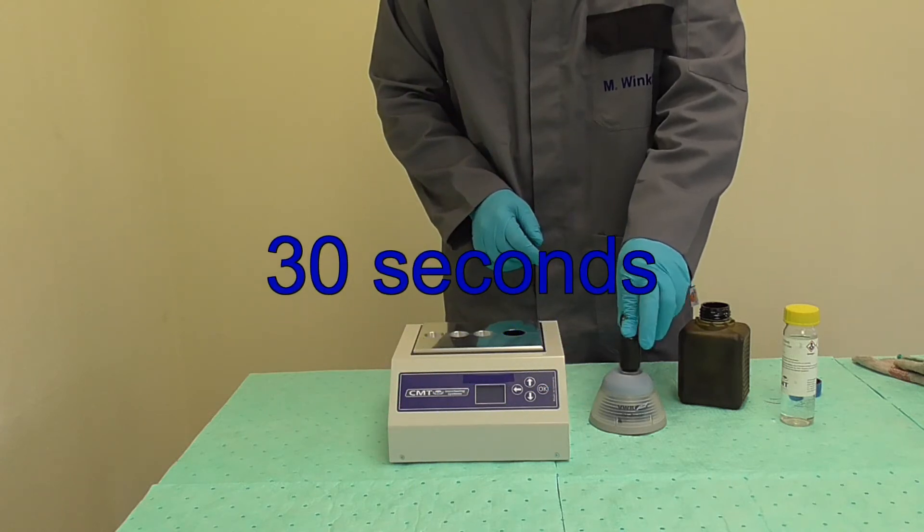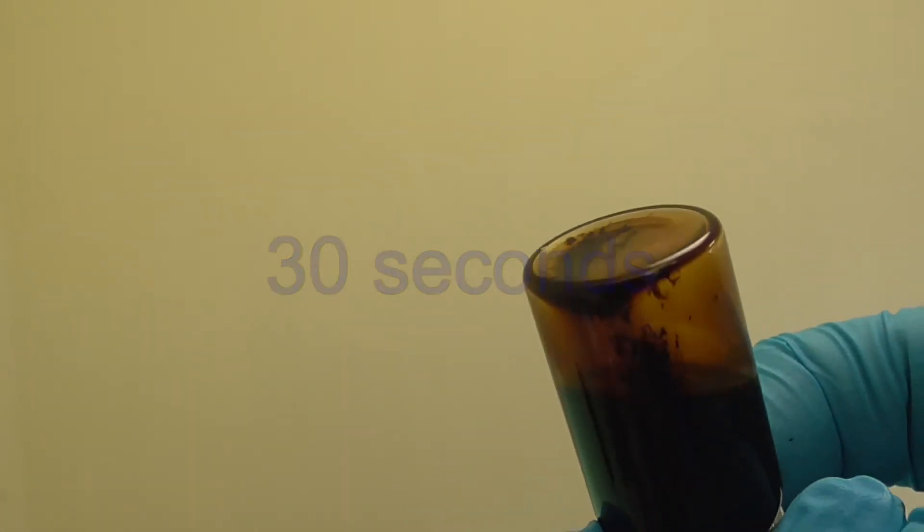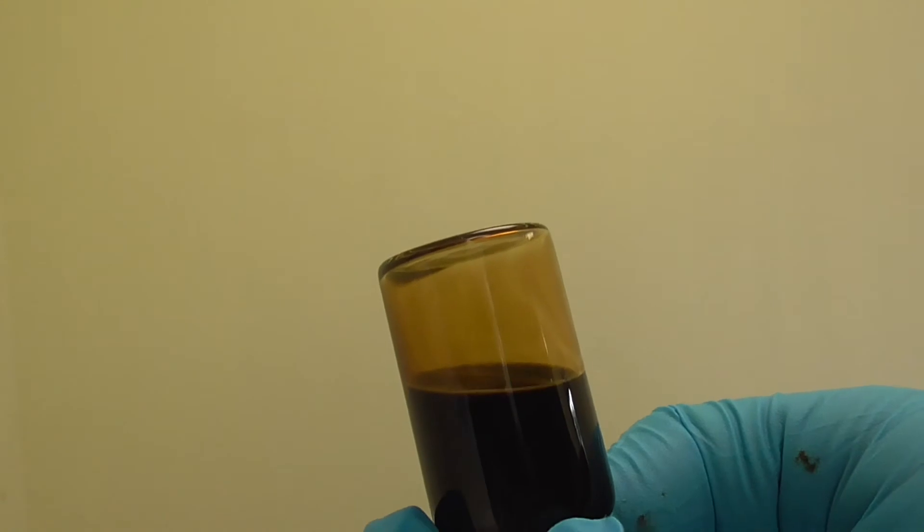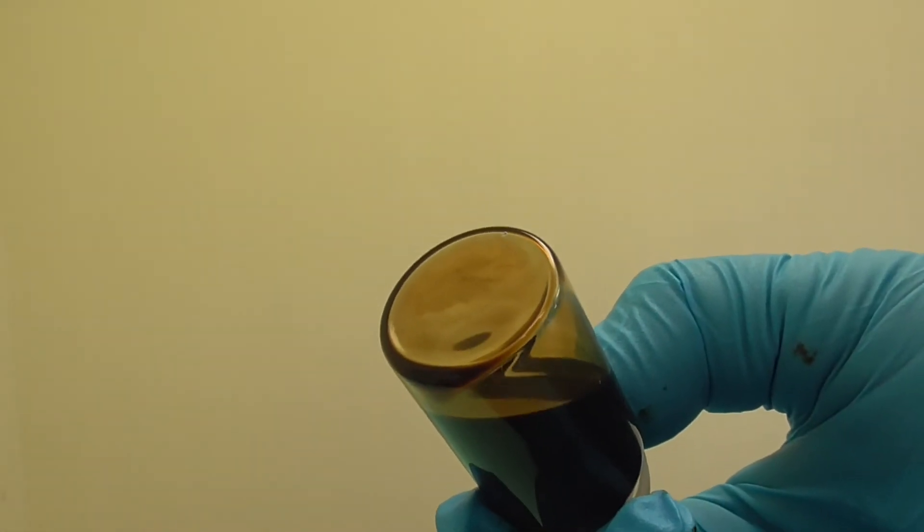This is a bad example of a homogeneous mixture. Please continue mixing the sample. Your sample should look like this without any visible deposits.